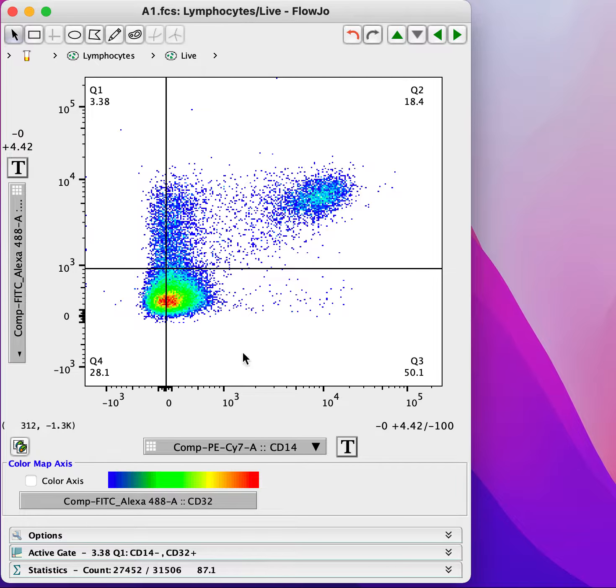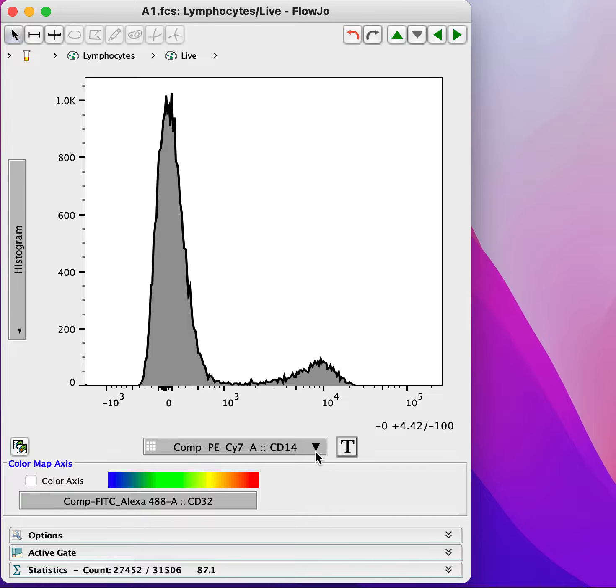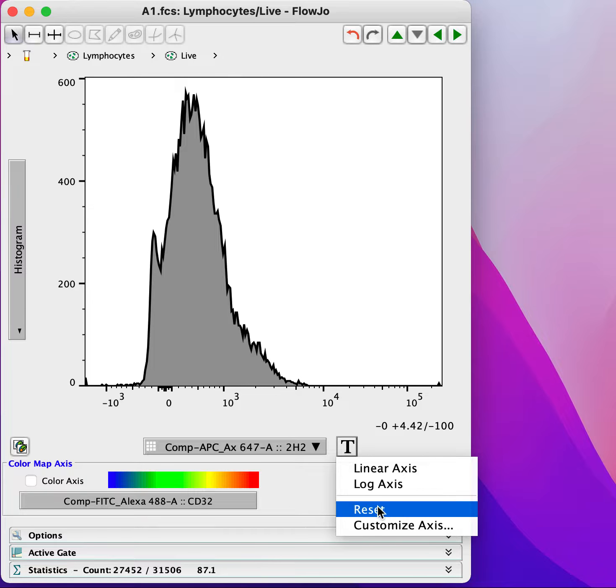Now, in this plot, we wouldn't really be tempted to change the scale at all. But sometimes when we're trying to find a representation of the data that makes it easy to interpret, it might be perfectly valid and helpful to change the scale. Let's have a look at another channel where that might be more tempting. So in this channel, we don't see a clear positive. And in order to sort of try and make sense of this data, we might be tempted to change the scale. So let's go ahead and do that.